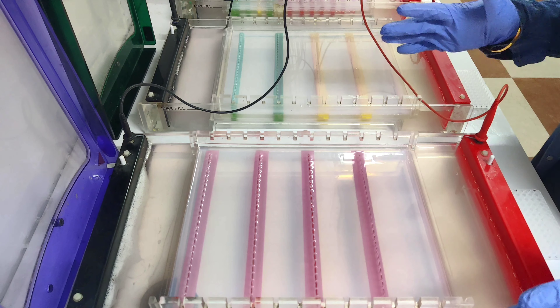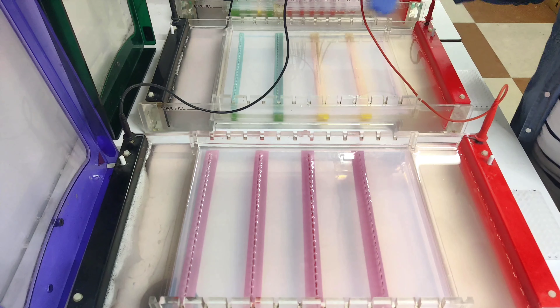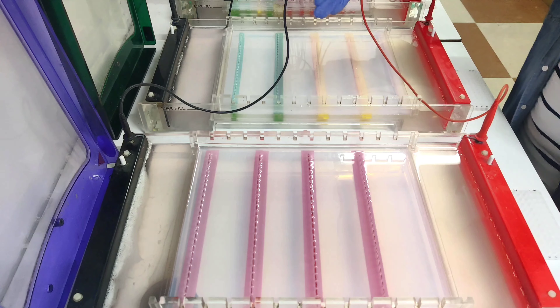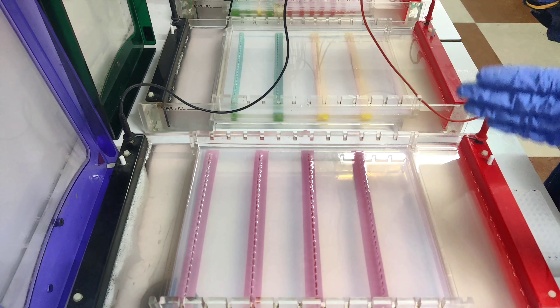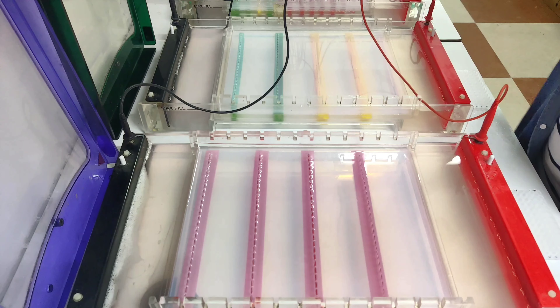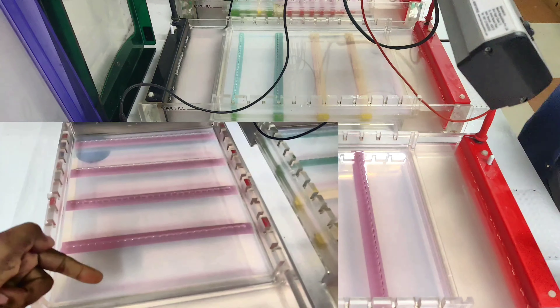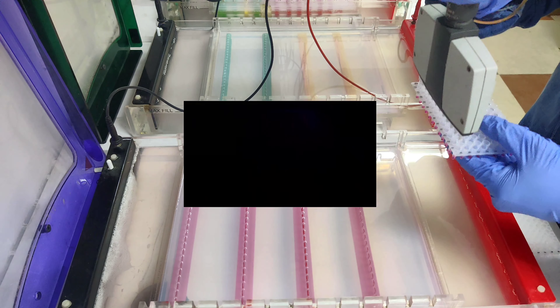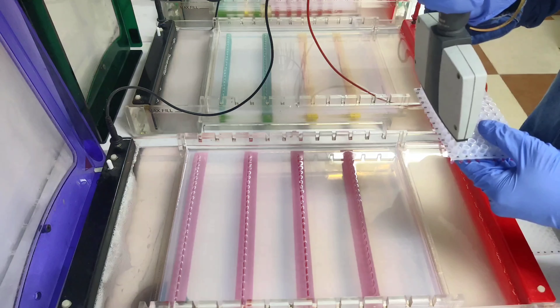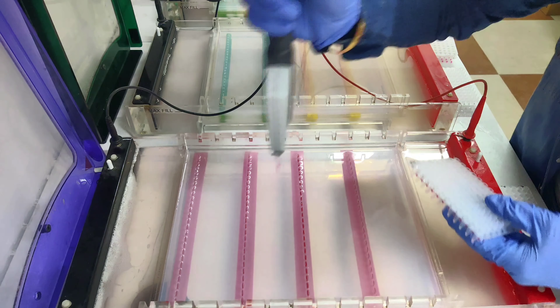Hey friends, now about two hours have passed and both gels have been running. You can see the dye front has almost reached the bottom. Now I am going to upload the second PCR product into this same gel. First let me show you with the UV light — I switch off the room light so you can clearly see the DNA bands. Now you can see these are our PCR products from the first loading.